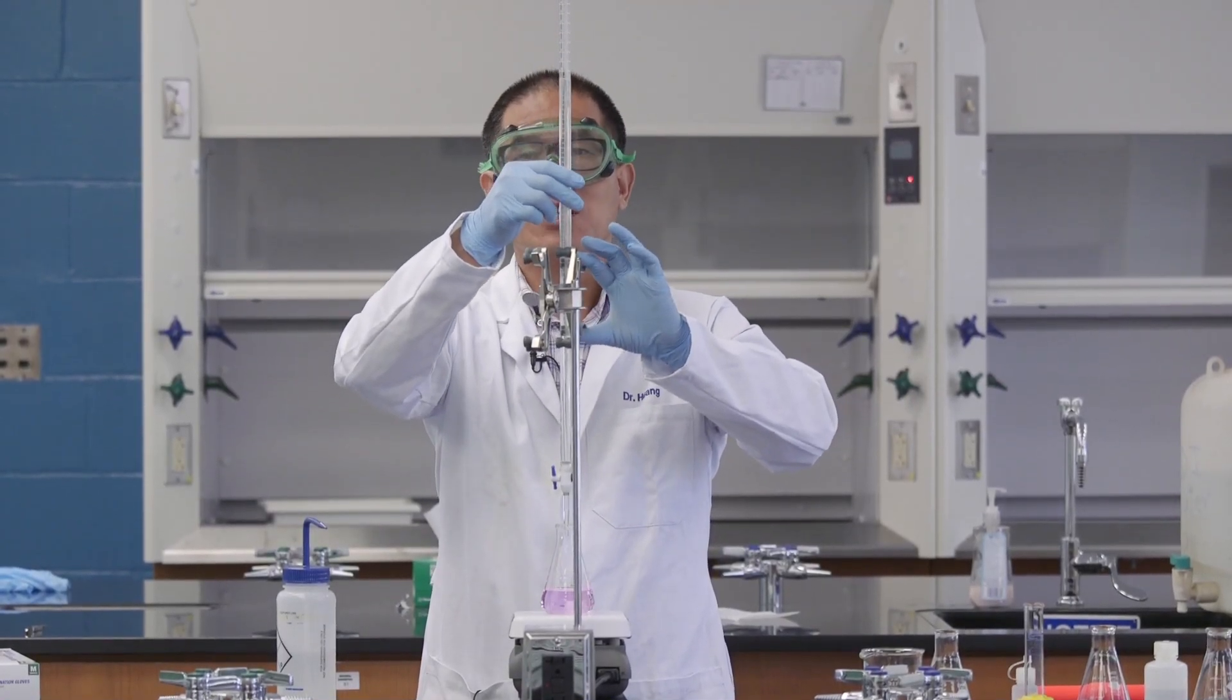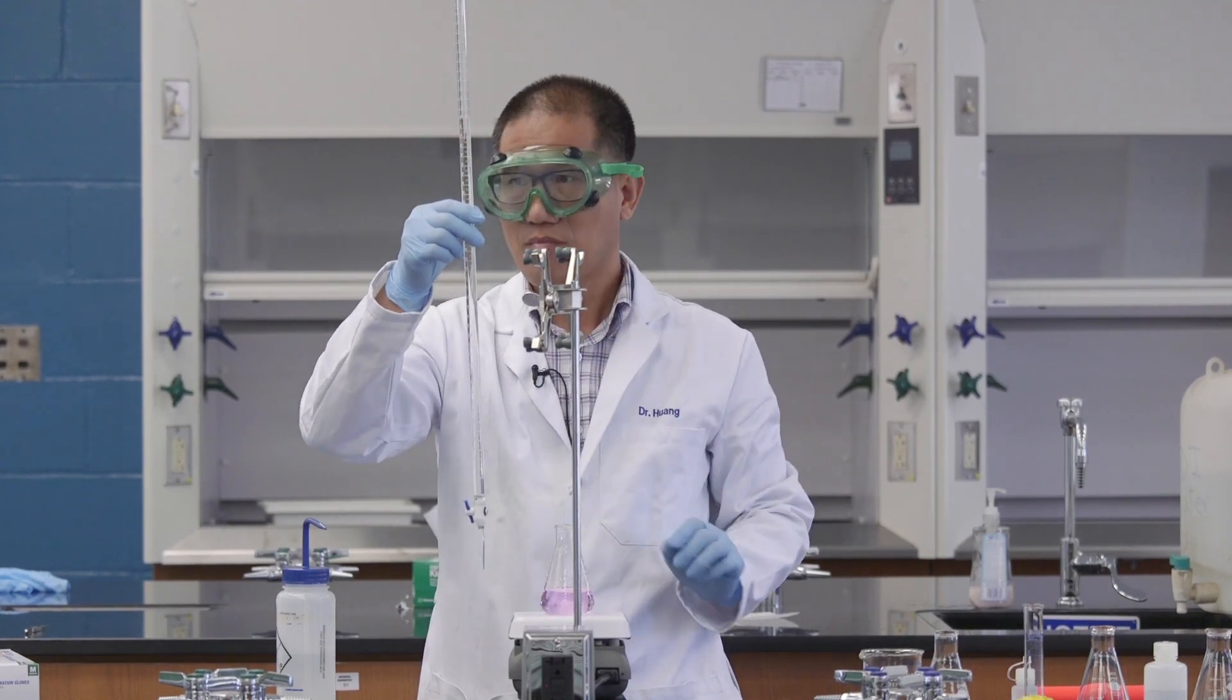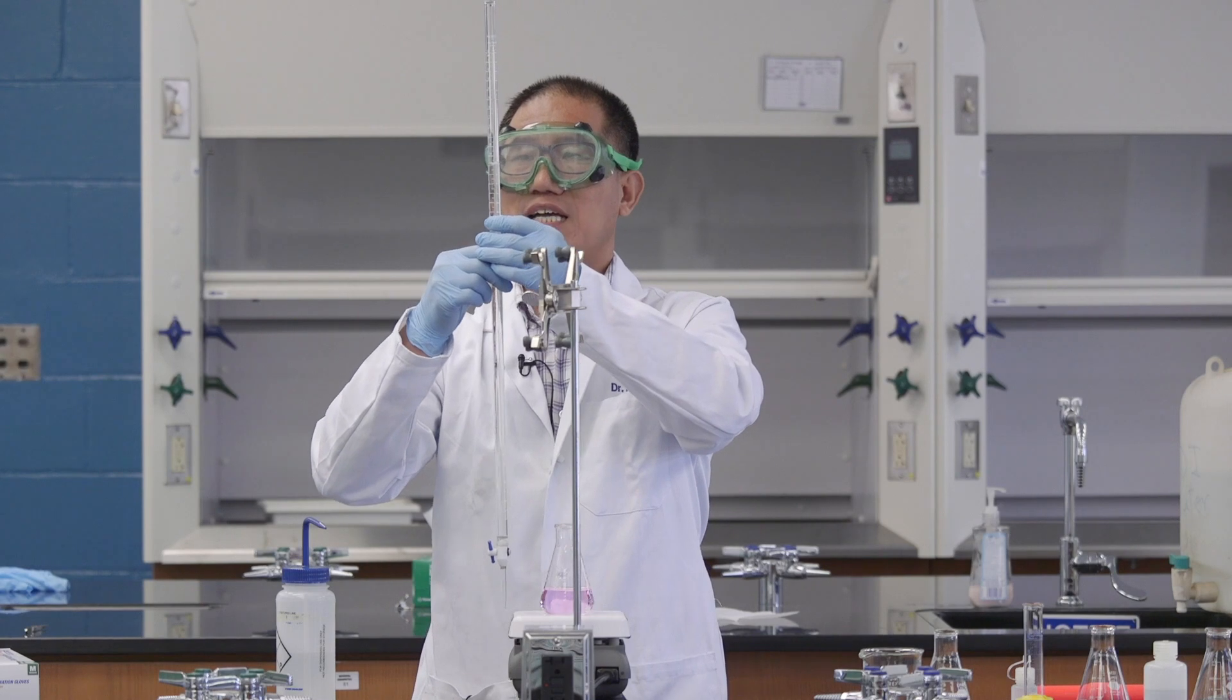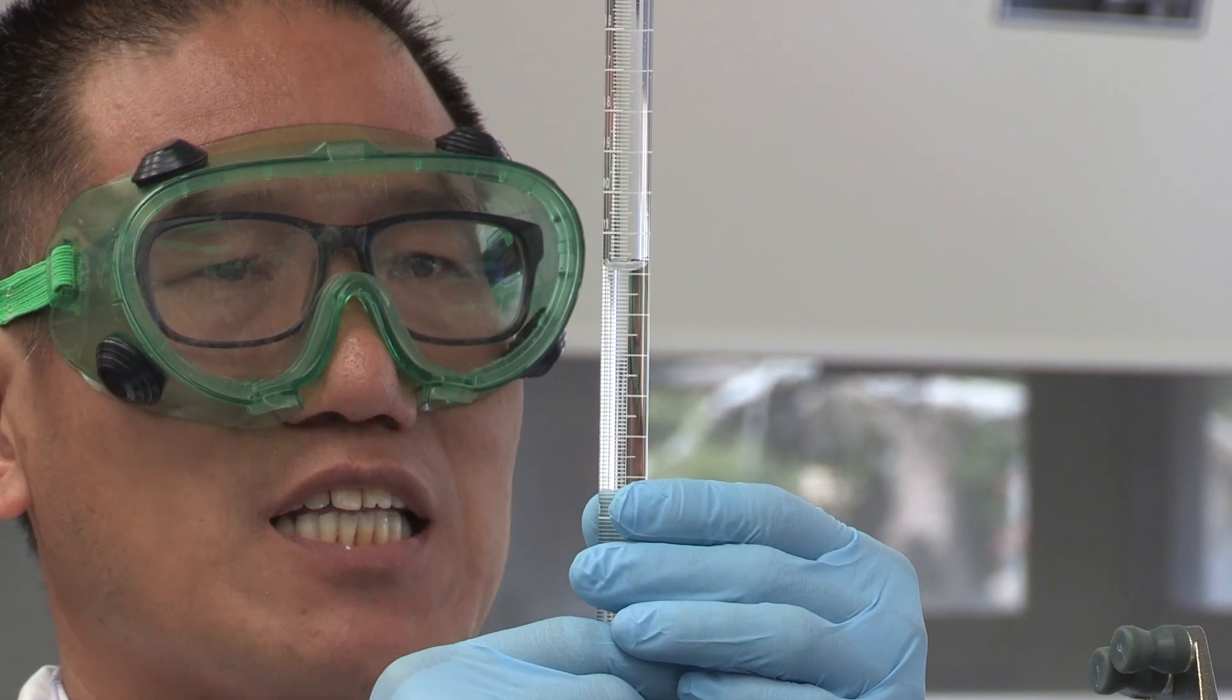I'm not that tall, so I need to take this off from the stand. And then let my eye to be the same level as the bottom of the meniscus.